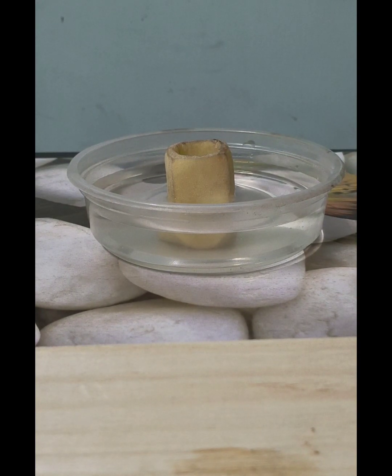And now the external environment, that is the water outside the potato cube, is distilled water. That is the most dilute form of water. So now it has water molecules. It's not a solution, it's pure water. So it has water molecules mostly concentrated. So water is at its high concentration in the petri dish.